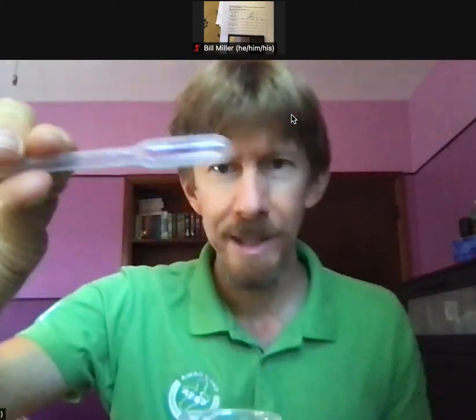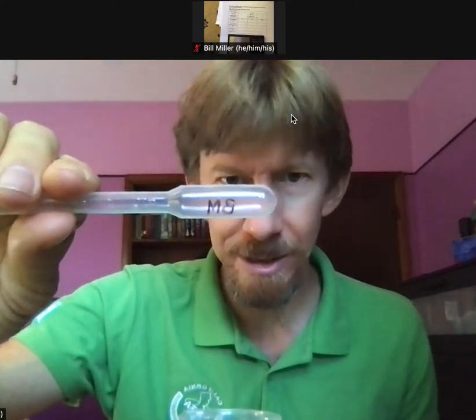It says mark one of your three milliliter plastic pipettes with your initials. I've got my initials on there — BM — using a permanent marker or a piece of tape. This is the pipette you will be calibrating. Take a picture of your marked pipette — please do that.